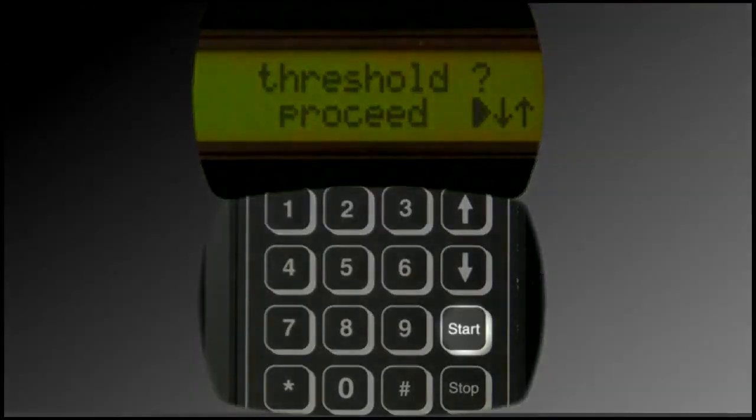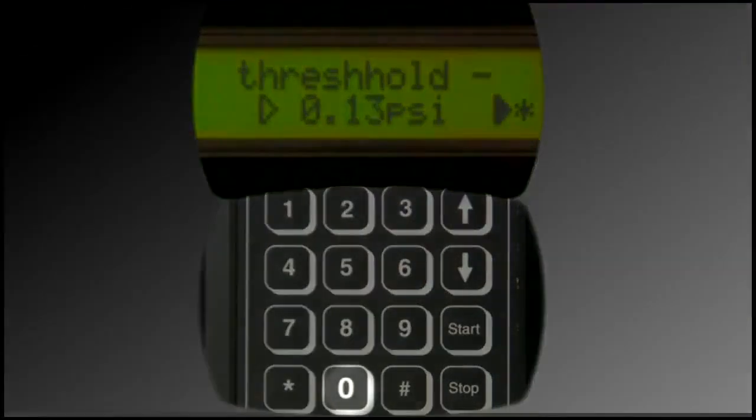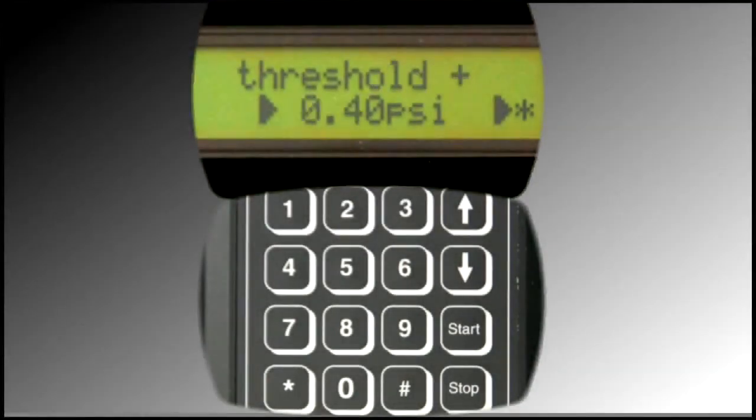Press the Start button to view the current lower pressure threshold. The setting programmed must be between 0.14 and 1.45 psi. If desired, the lower pressure threshold value can be changed. Numbers move from right to left when entered. To save the value, the star button must be pressed. This also leads to the next menu, the upper pressure threshold value.